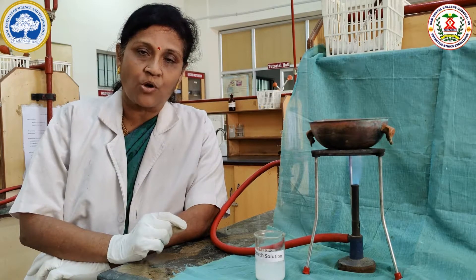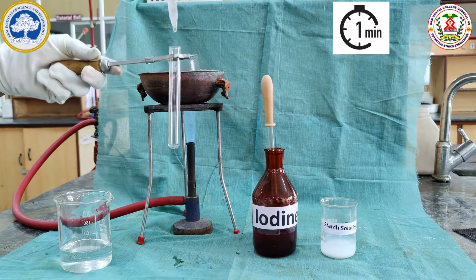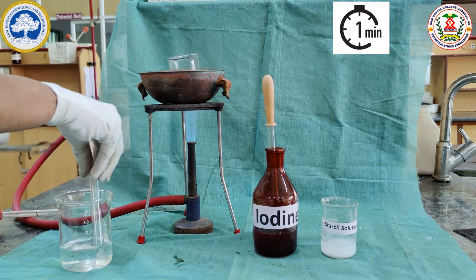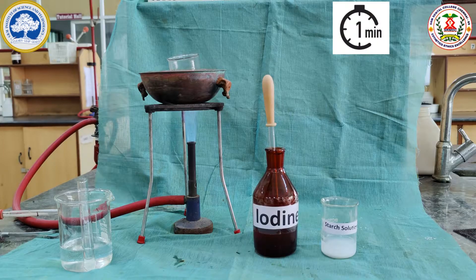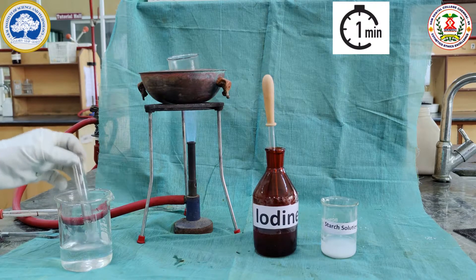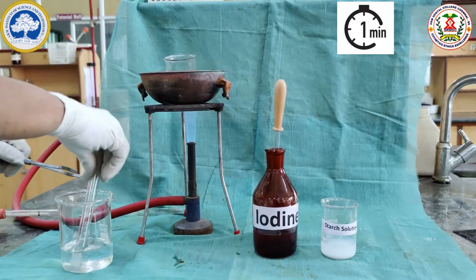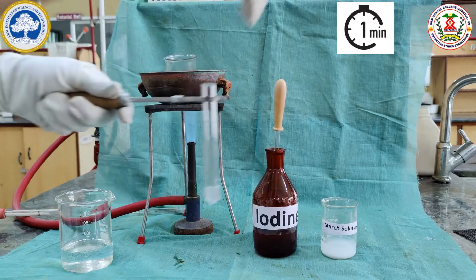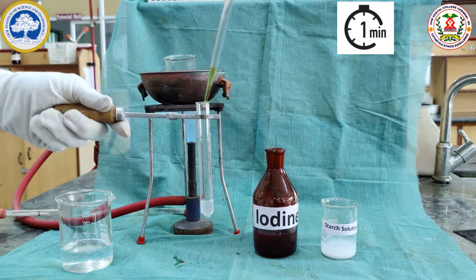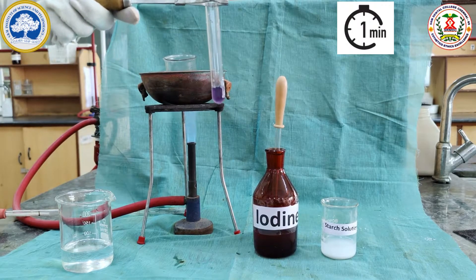After 1 minute, 2ml of the sample is taken, cooled well, and the iodine test is done. This is the soluble starch stage. With iodine solution it gives an intense blue colour. After cooling down, the soluble starch stage sample is taken and iodine test is done. We can see the presence of blue colour but the solution is clear.